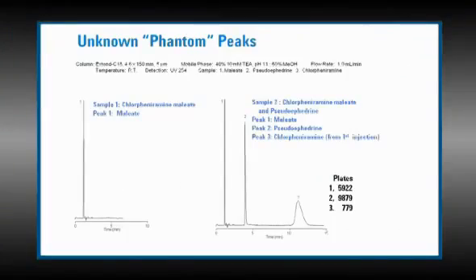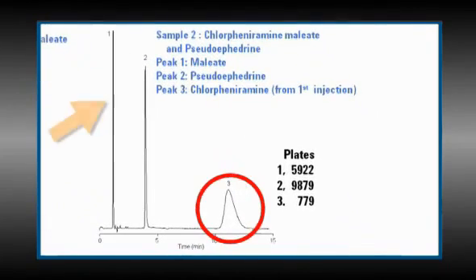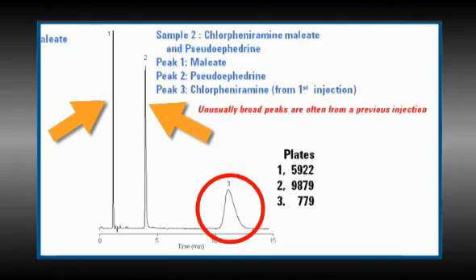We'll discuss gradients in another video. But even with isocratic separations, we should always start with a very strong mobile phase. For example, in this case, maybe 75% methanol or even higher, and also use a higher flow rate to get components to come off the column in a more reasonable amount of time. For a 150 millimeter, 5 micron column, we should be able to use a flow rate of around 2 mL a minute. Another clue that this is a wraparound peak is that it's much broader than the peaks that elute near it. In isocratic work, one almost never finds a broad peak so close in proximity to a narrow peak, such as the pseudoephedrine peak in the figure.